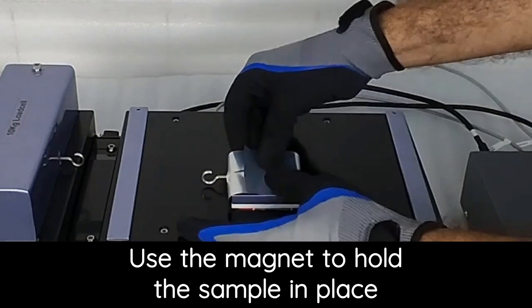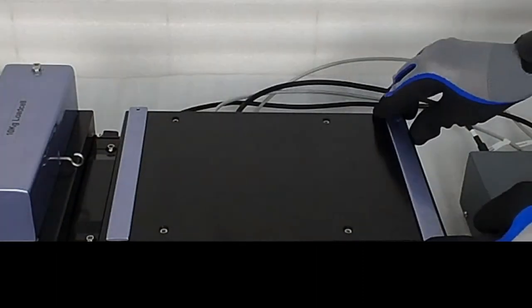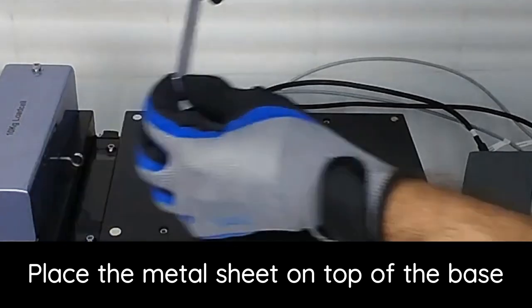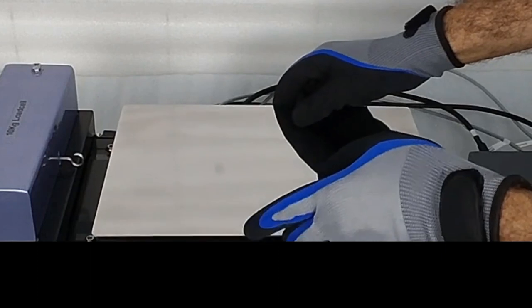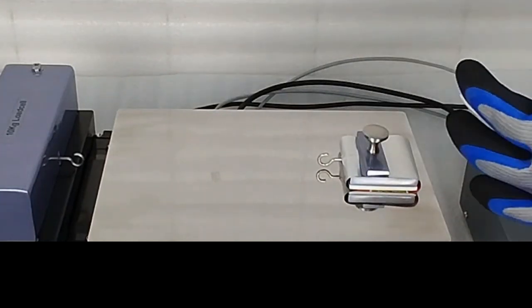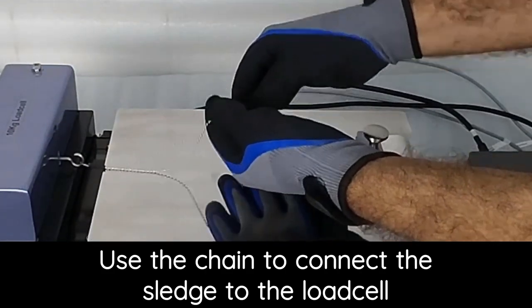Use the magnet to hold the sample in place. Remove the metal strips. Place the metal sheet on top of the base. Place the sled with the sample on the bottom layer. Use the chain to connect the sled to the load cell.